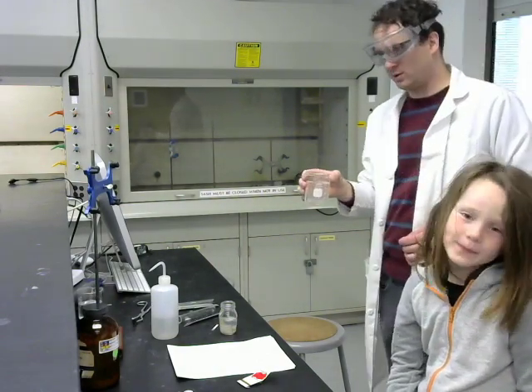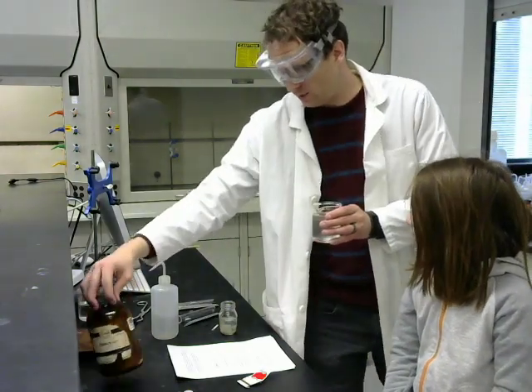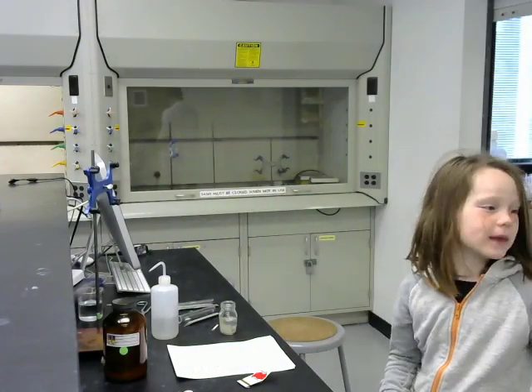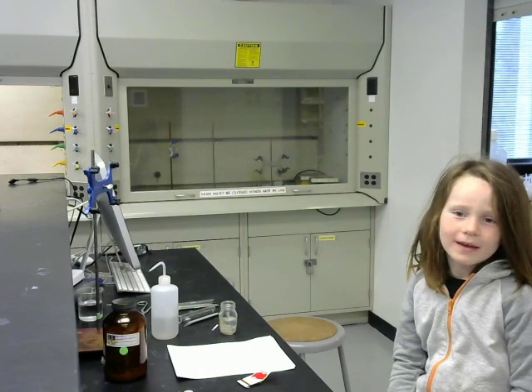Now I'm going to replenish this water, and we'll do the same thing with calcium metal instead of the sodium metal. There's the letter C on that. On what? That. Oh, there is, isn't there? C. How about that?